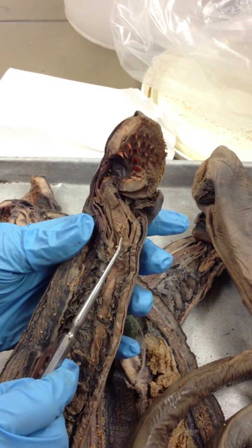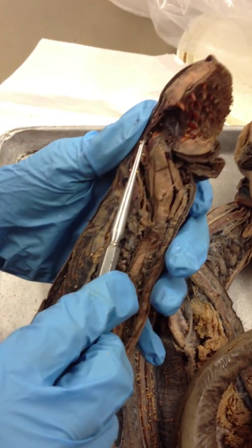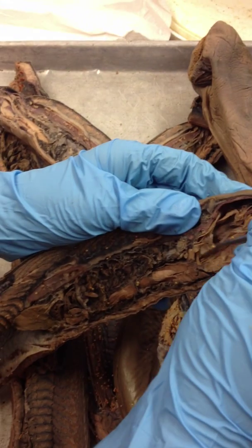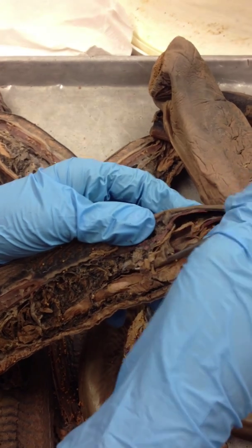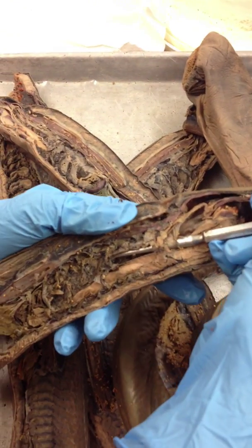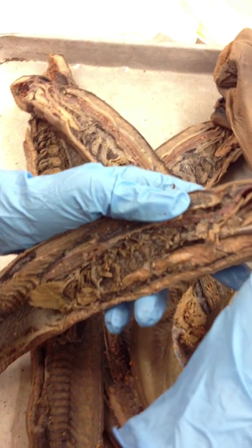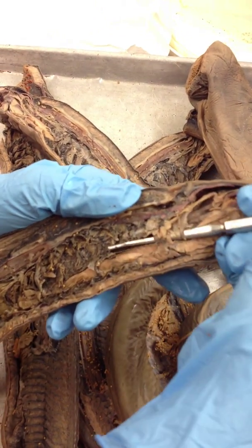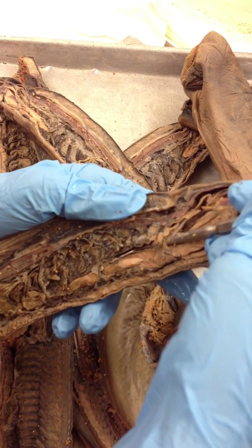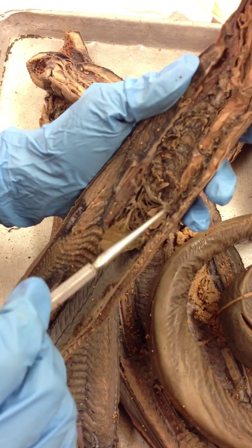Here's your esophagus running down to this velum, and if you pass that, it takes you to the gill pouches over here. The velum guards the entrance to this pharynx that my probe is in, and the esophagus leads into the remainder of the digestive tract, which we cannot find here.